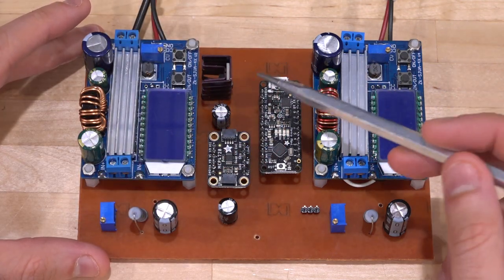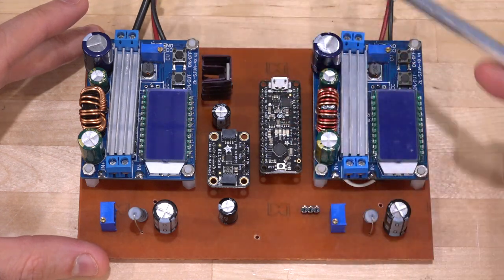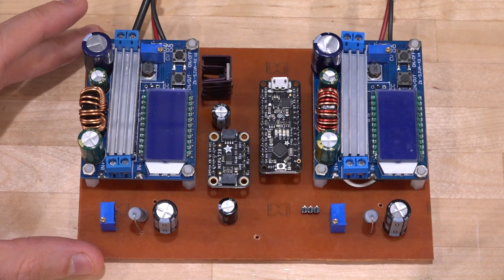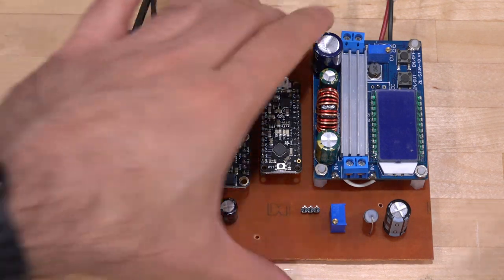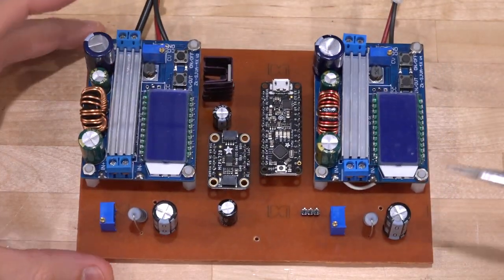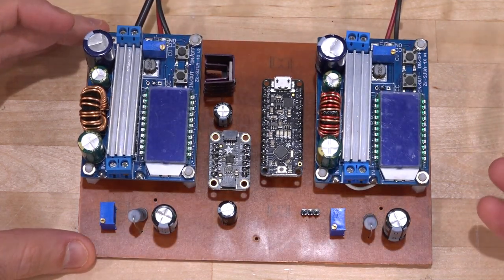So the Arduino is now basically constantly sampling the voltage seen from these two ports and adjusts and sets the limit for the current set by these two DC-DC converters. That's it. That's really all it is doing. It's quite straightforward. So I just mailed this out. There was a minor mistake in there that I had to fix with a bodge wire. I only made one version of this PCB, so I really wanted to get it out of the way.